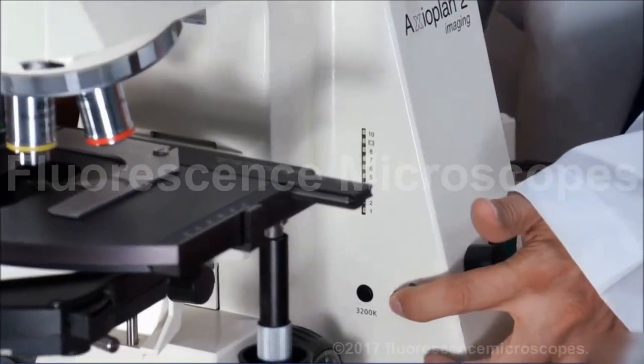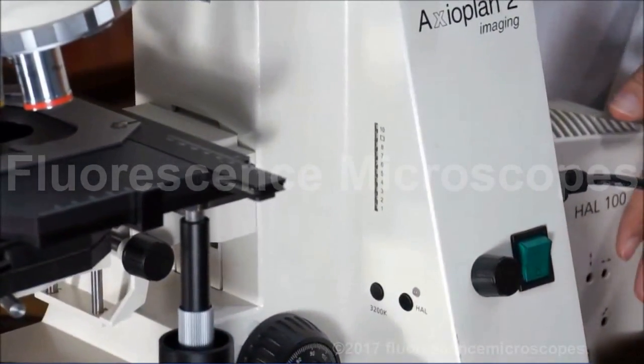You've got a halogen lamp button. You can press this to turn on and off your halogen lamp at the back.